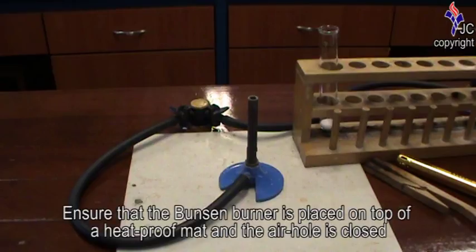Before lighting the Bunsen burner, ensure that the Bunsen burner is placed on top of a heatproof mat and the air hole is closed.